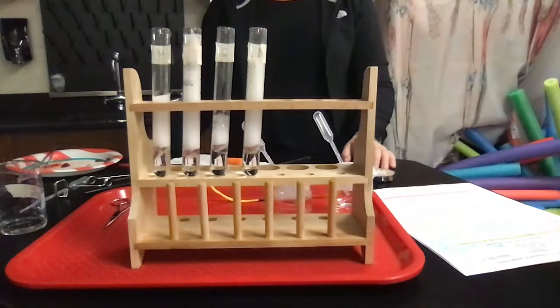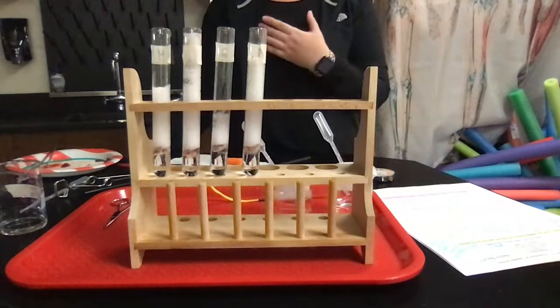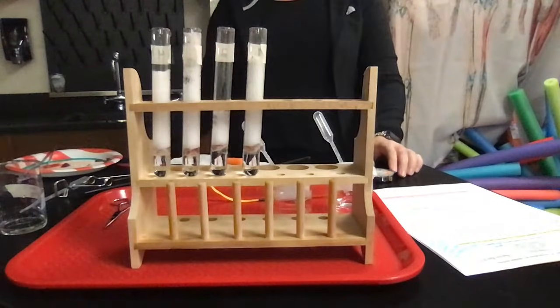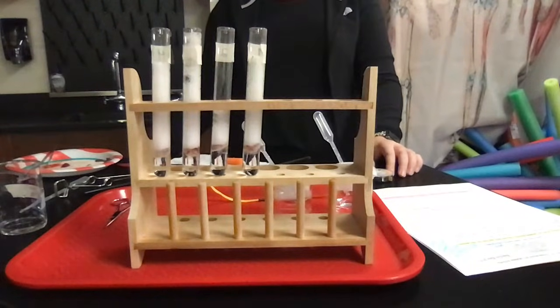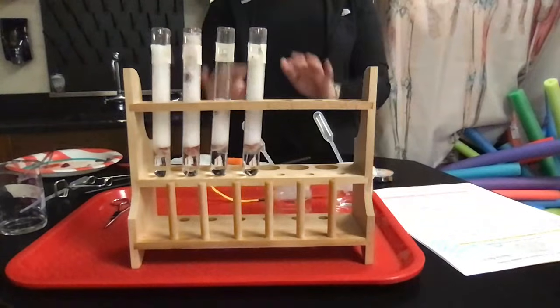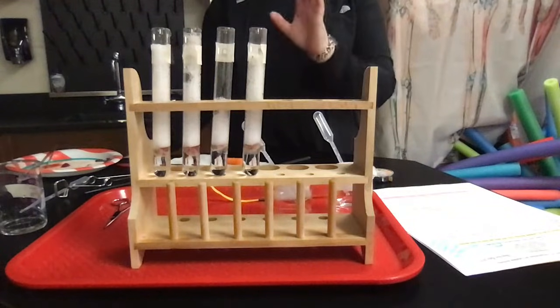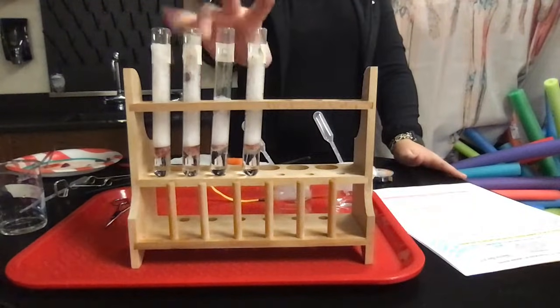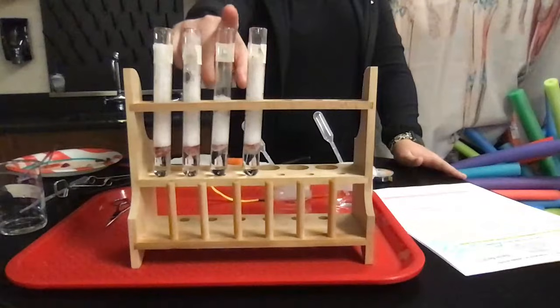So based on what I'm seeing, the reaction rate for 3 so far is the best. So I would say 3 is the best, and then maybe 1 and 4 are about tied, and 2 is the worst reactivity. So I'd maybe rate this at a 5, and maybe 4s or 3s, and then maybe a 2 here. Okay, so does that make sense?